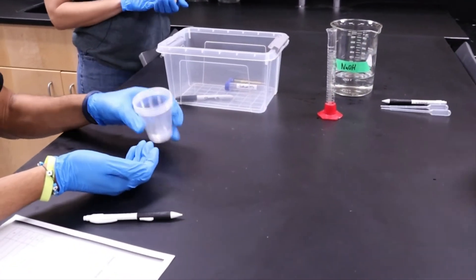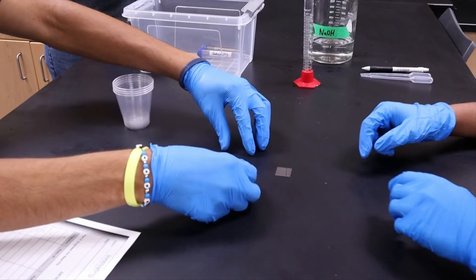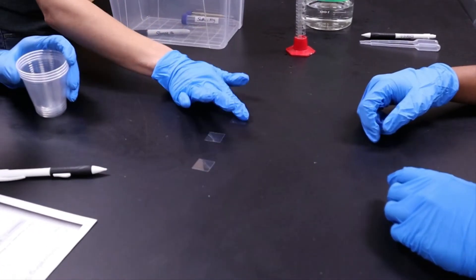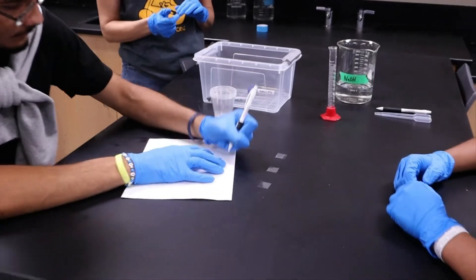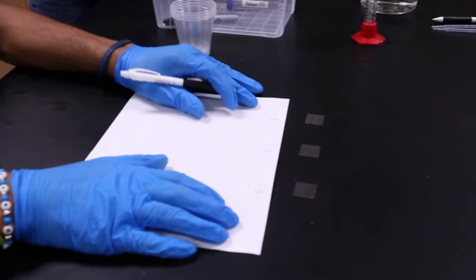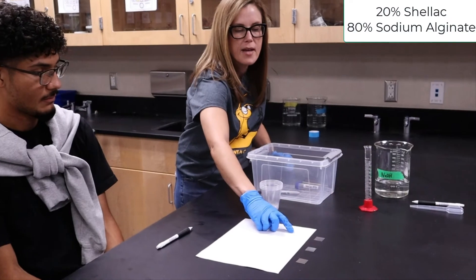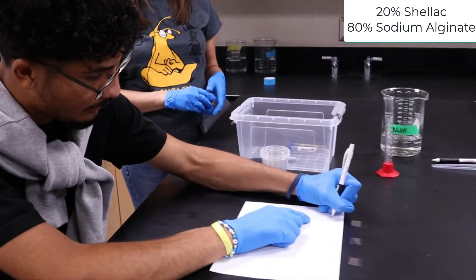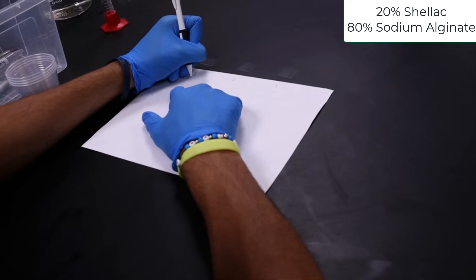You're going to practice three different ratios for this part of the experiment. Make sure you know the order the cover slips are in. For ratio one in today's demonstration, we'll do 20% shellac to 80% sodium alginate. Write that underneath number one on your data table so we can keep track of it.